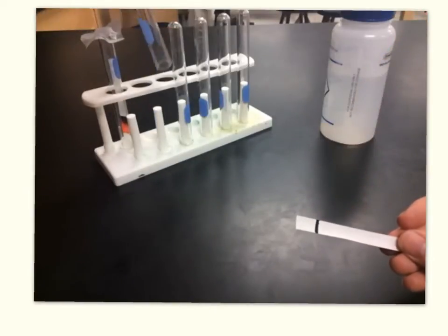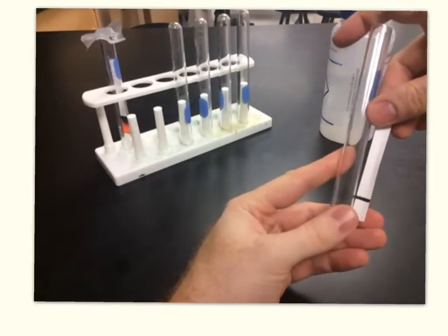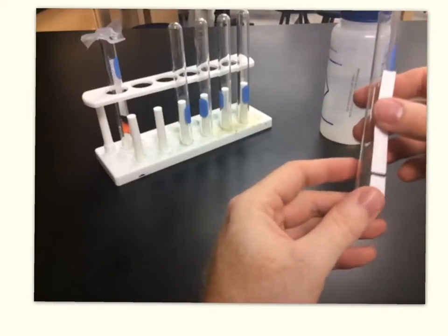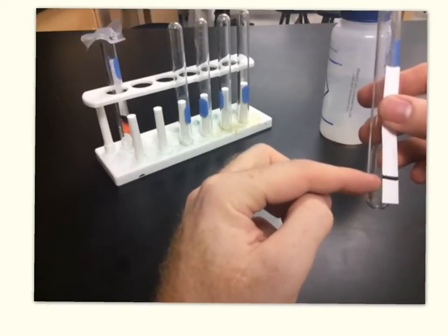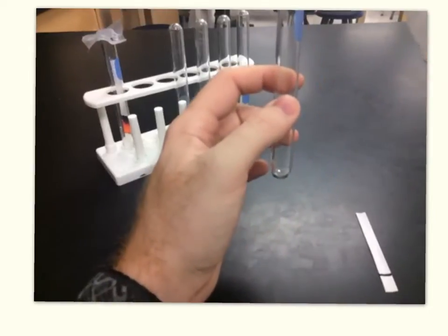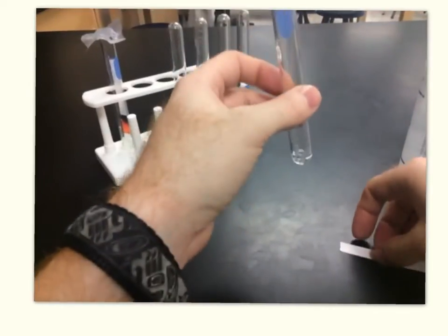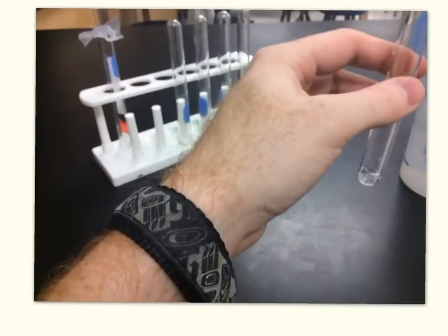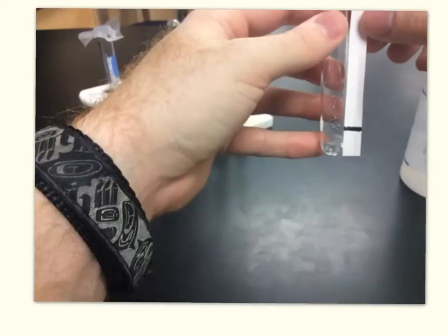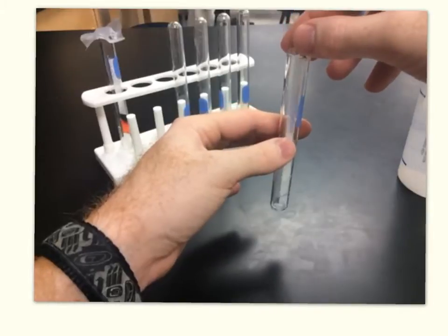We need to prepare our chamber, which is going to be a test tube. The key thing here is that we don't want the mobile phase to be above the level of the analyte when we start the experiment. So when we put the water in, we've got to make sure it's below the marker line — we can only put about that much water into this test tube. We go ahead and add the mobile phase, which in this case is water. It doesn't need very much because the water is going to move up the paper by capillary action. I just want to double check that the water level is not up to where the marker is, then carefully drop the paper down into the chamber.